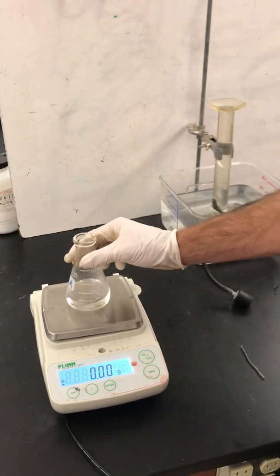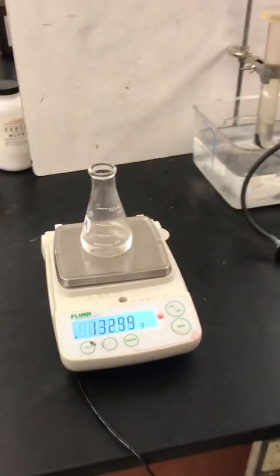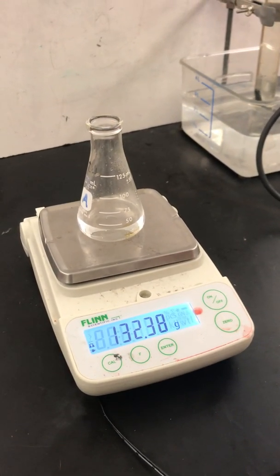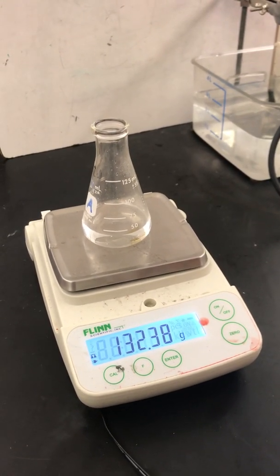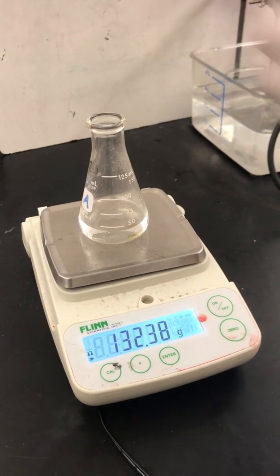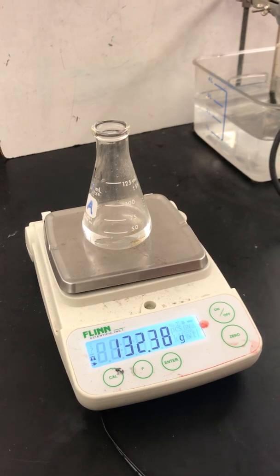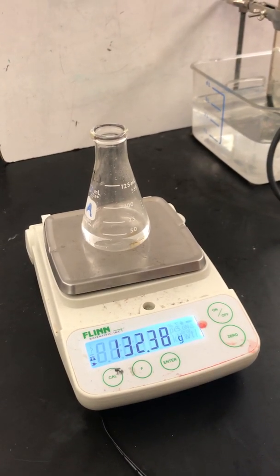You would have the flask on the scale, being really careful not to spill anything. We don't want to get that scale wet. You could zero it before you start, but you won't have to. And you'd add your magnesium to the flask. And you'd have a stopwatch. You've decided in advance how long you want to run this experiment for. You figured that out during your trial run.